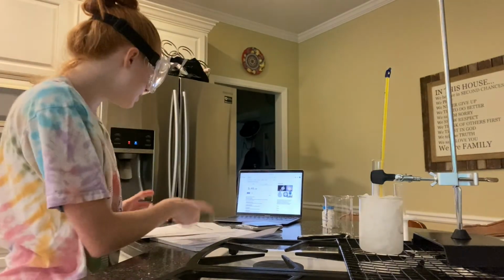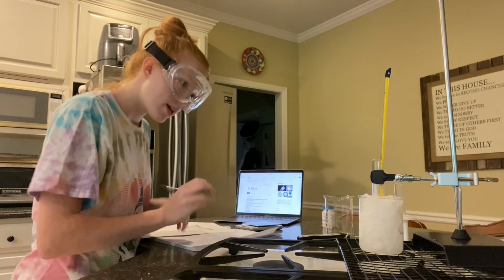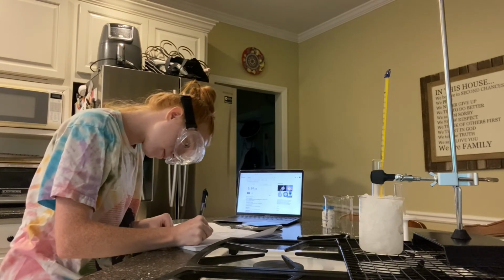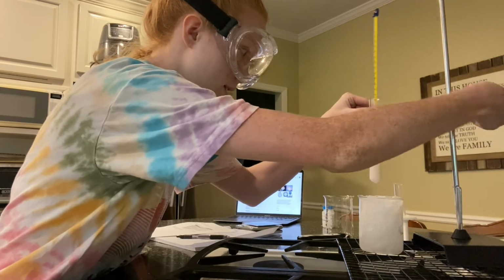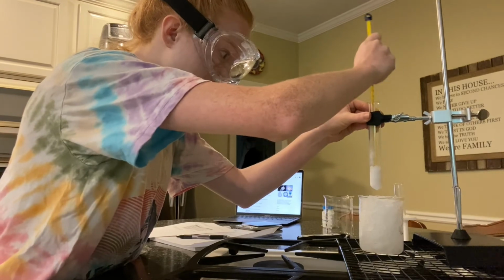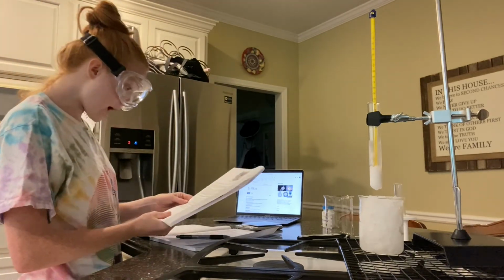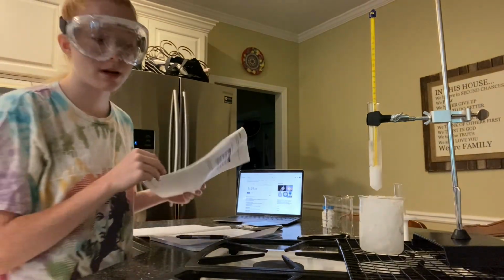It's been 3 minutes and my solution is at 33 degrees Celsius. And I believe if I check it, it is completely frozen.